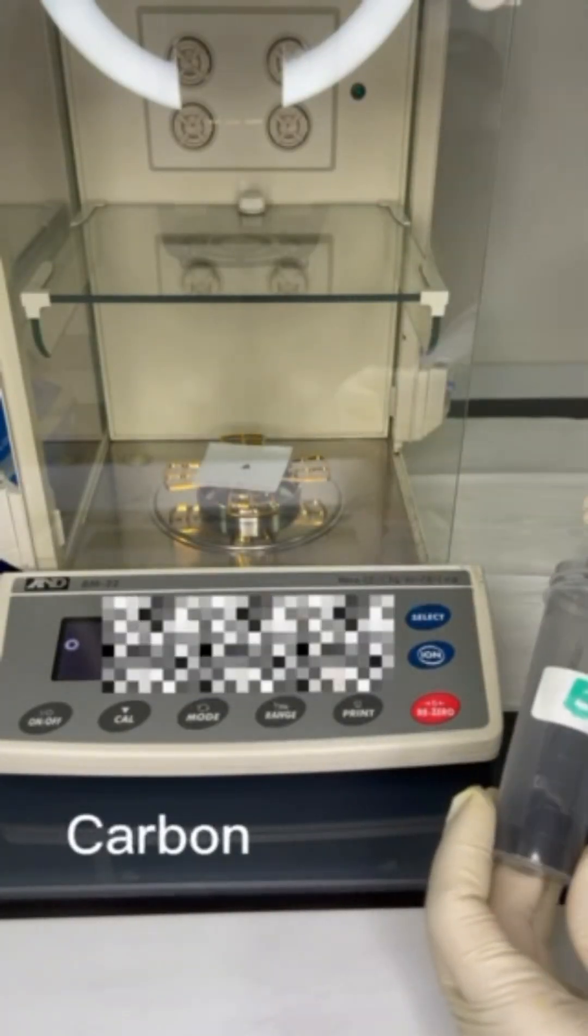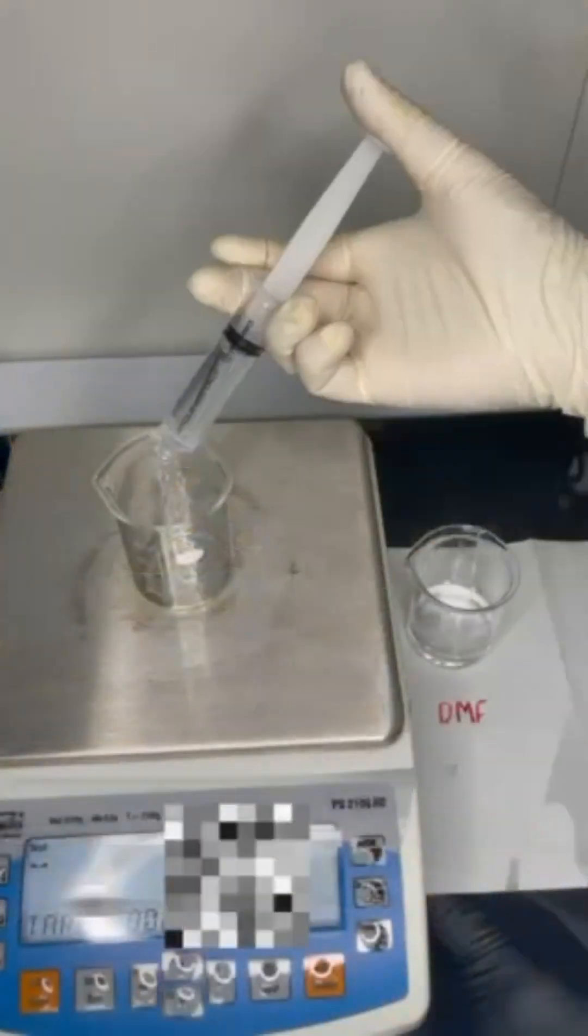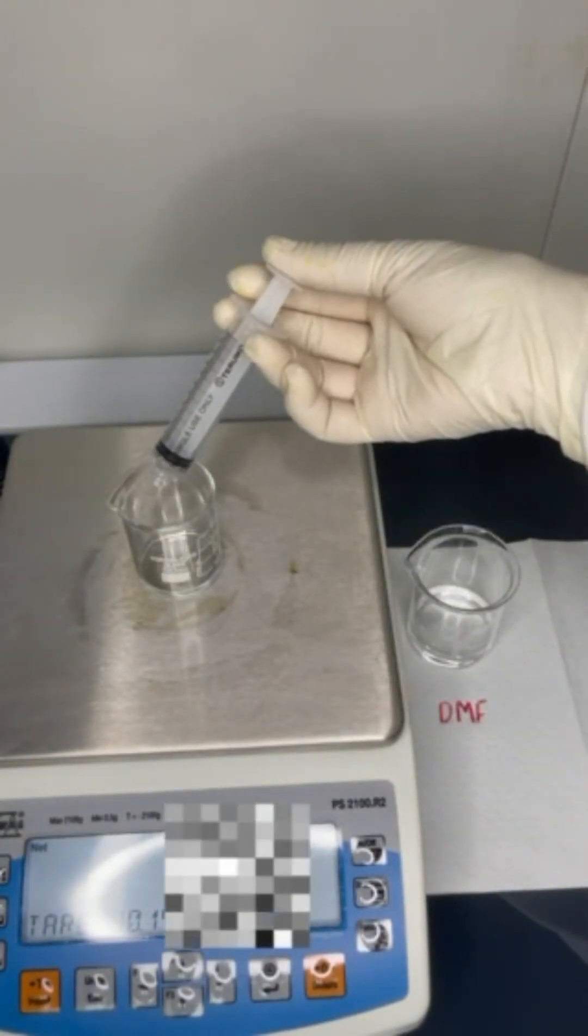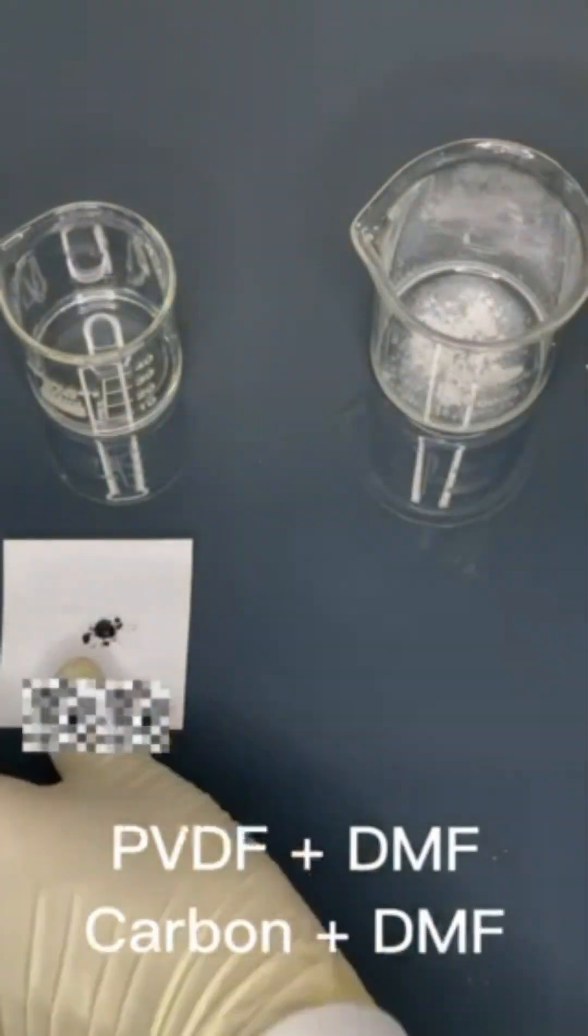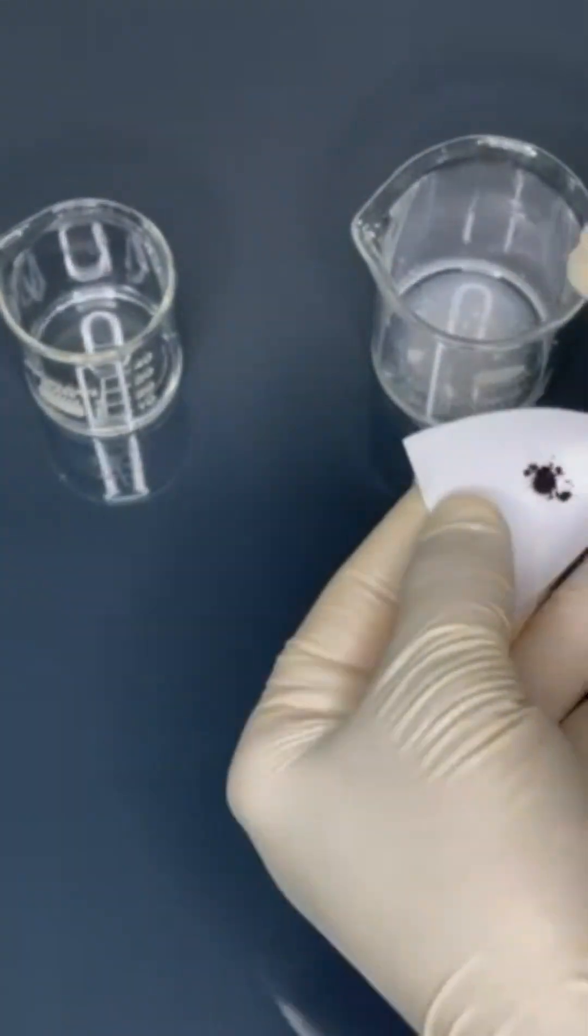We use the filler carbon with the solvent in two different beakers. Add polymer and filler to them.